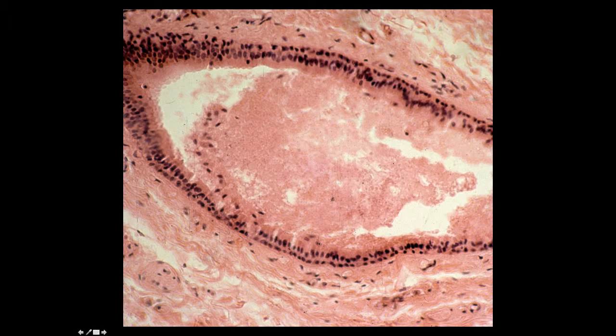Now you have to be careful because in some areas, here we're getting a tangential section through this duct. This would almost look like a pseudostratified epithelium, and in some areas you almost think maybe it's a stratified cuboidal epithelium because the epithelium looks more cuboidal than columnar. So sometimes this is a judgment call, but in an area like this, there's no question that these surface cells are columnar, so stratified columnar epithelium.